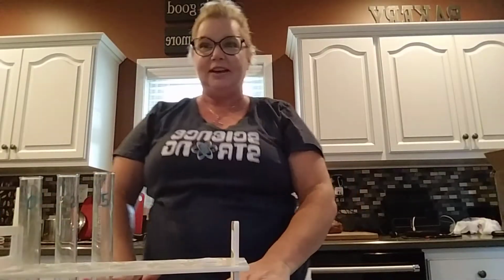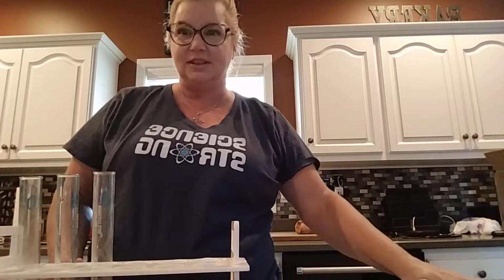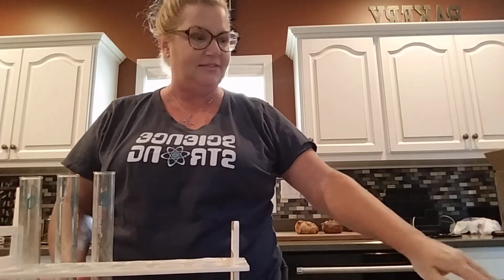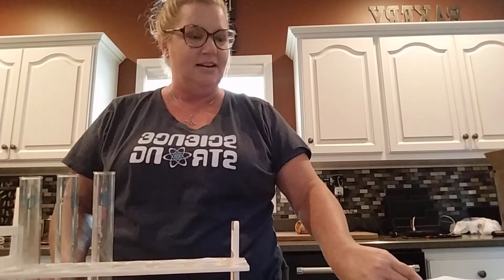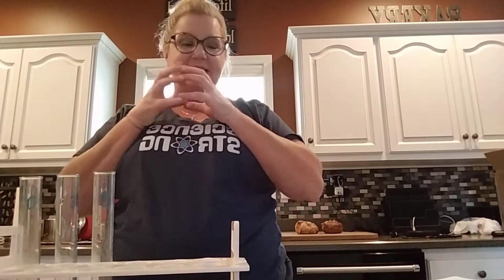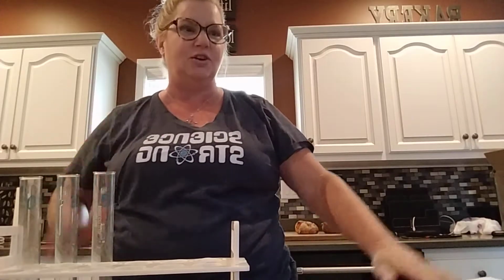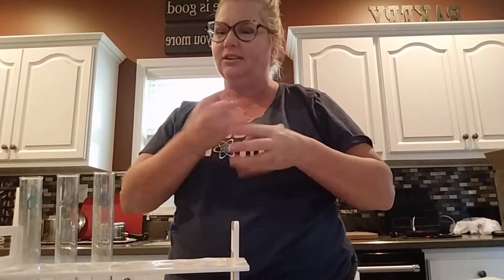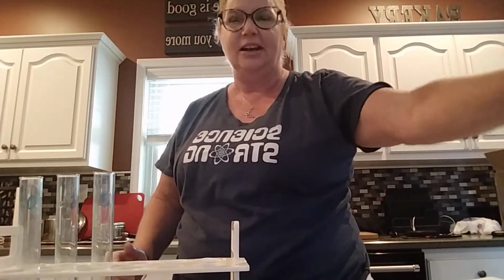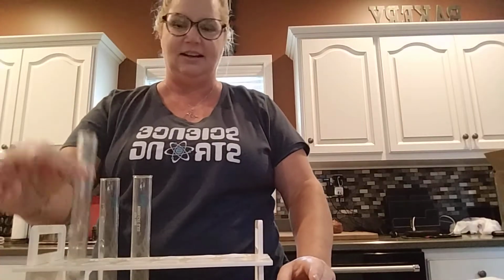At this point, you should have made your hypotheses as to what effect all those conditions would have on the enzyme activity. And as you see, we're going to be taking qualitative data, trying to look at the foam intensity from a 0 to 5. So what I want to do first is show you what a 0 would look like, what a 3 would look like, and about what a 5 would look like, so that as you're looking at the different test tubes, you can kind of get an idea.